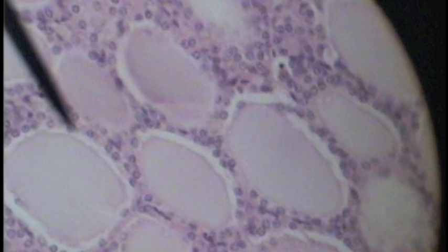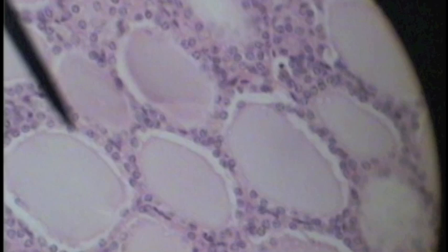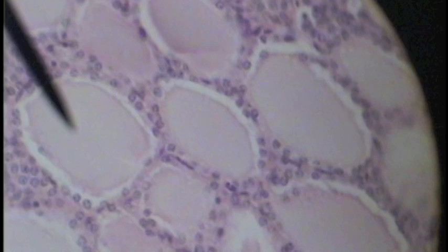The pointer is on a follicular cell that forms a sac that contains the colloid. Here we see the colloid — the thyroglobulin.